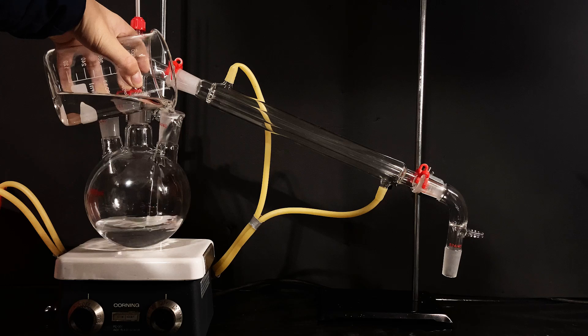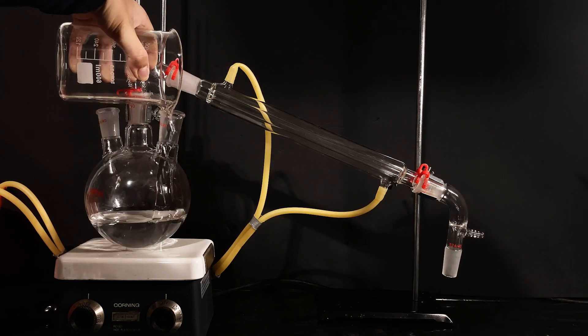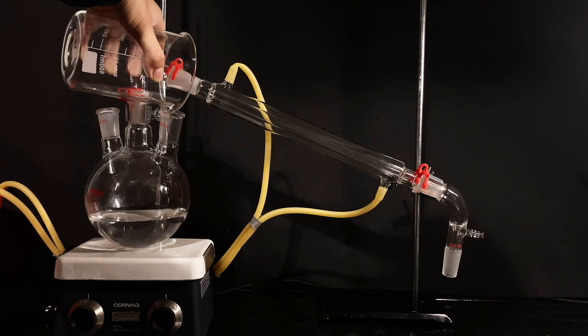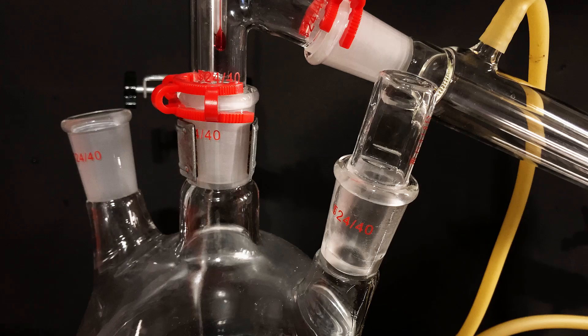Now you may have seen that I put together a simple distillation in the background. I then got started by emptying this entire bottle of 300 milliliters into a round bottom flask, and I cranked up the heat.